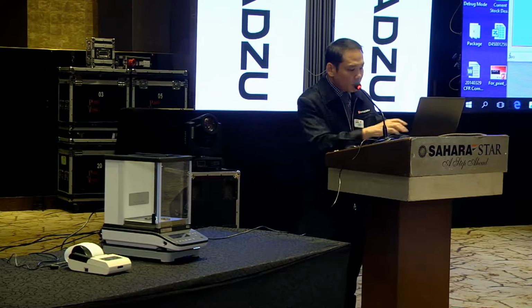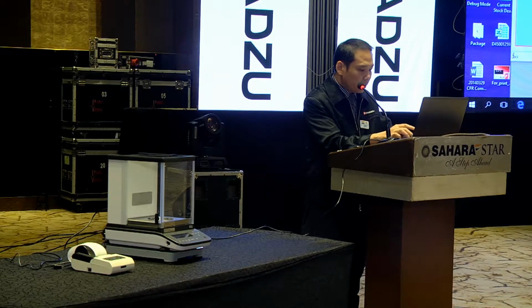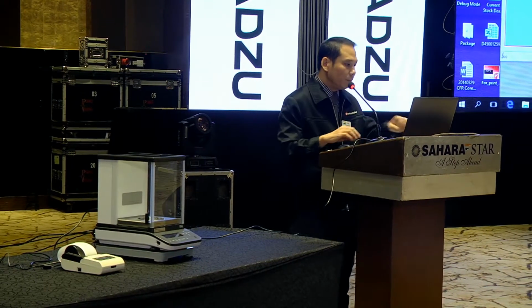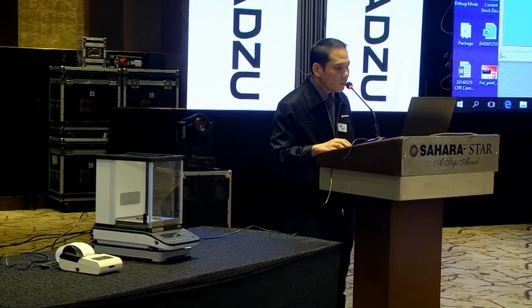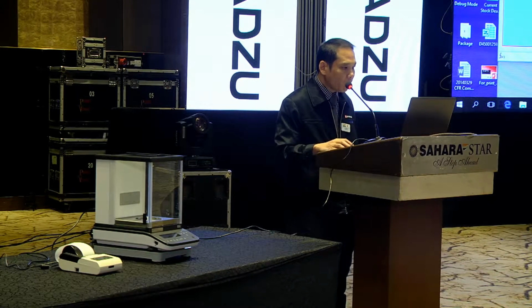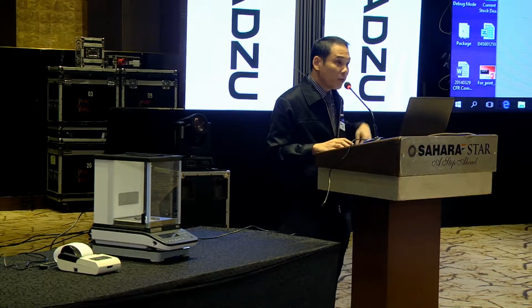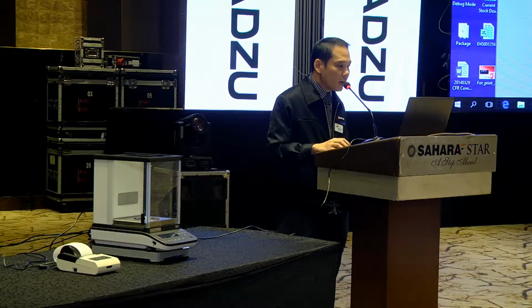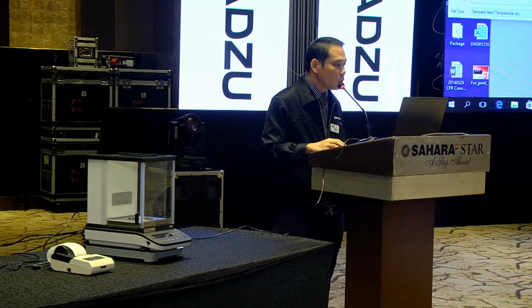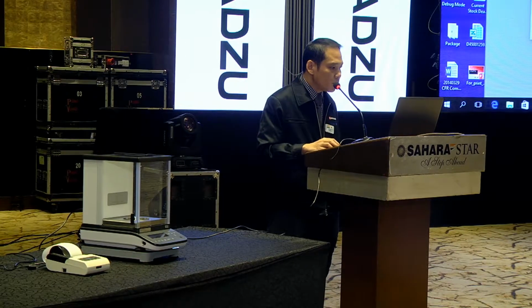So I give the name tare net gross, and I save the template. Okay. So now, when I perform the weighing function again, I can call up this template. This is the one I just created, right? Tare net gross. So I can use this.